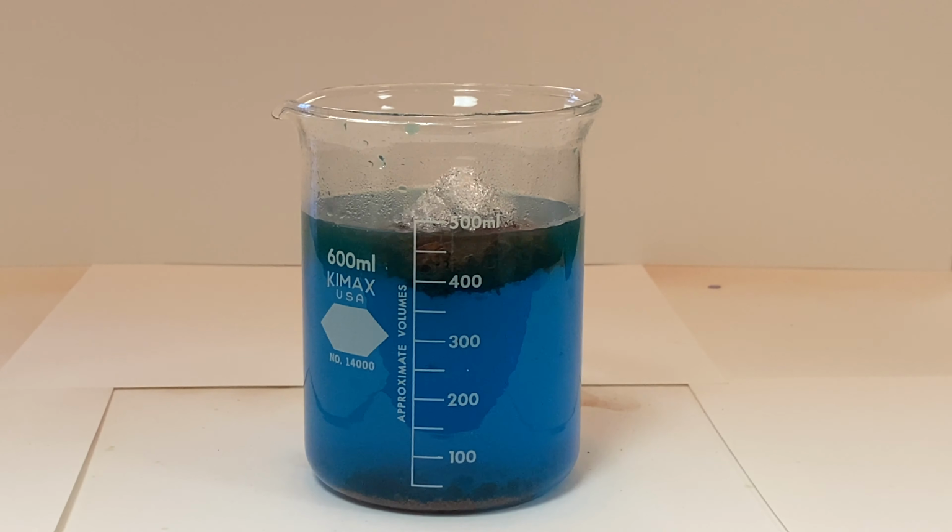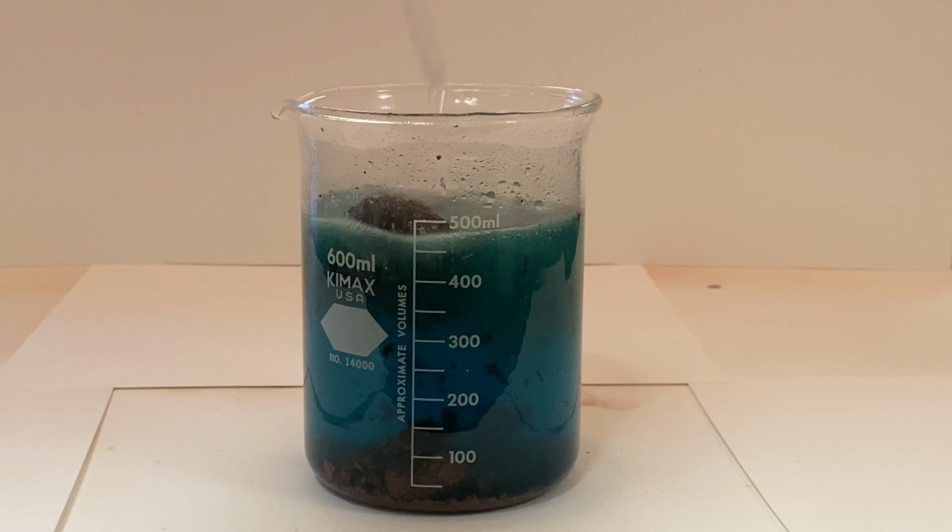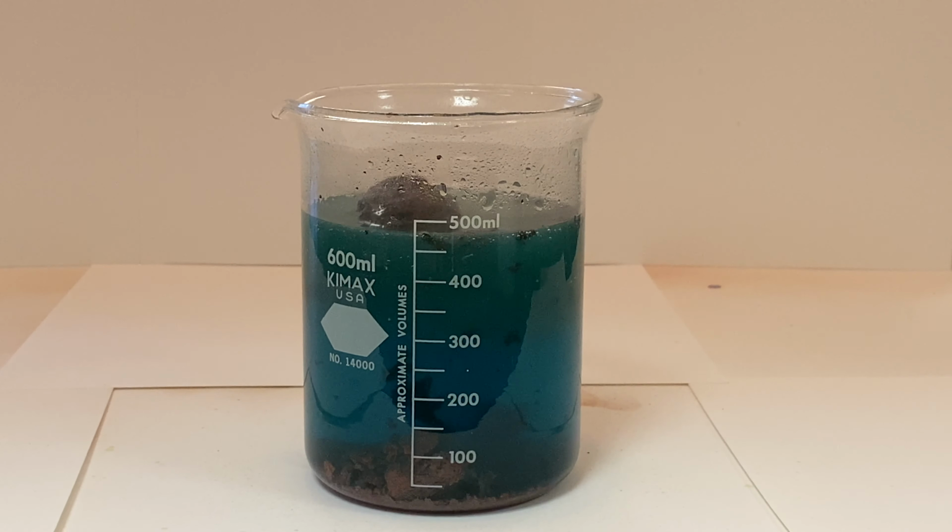One thing you'll notice also is bubbles are forming. That's actually part of another side reaction that's happening with aluminum and other things that are present in the beaker, and not part of this reaction at all. And sometimes that happens in chemistry. This reaction won't actually go to completion here because it will take over a day. So let's go ahead and take a look at what a single replacement looks like at a very basic level.